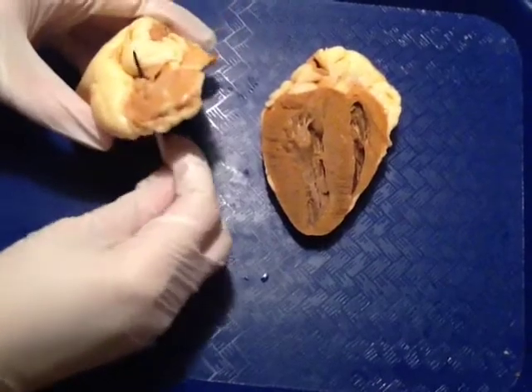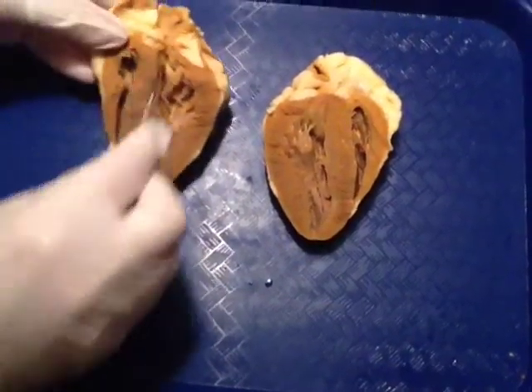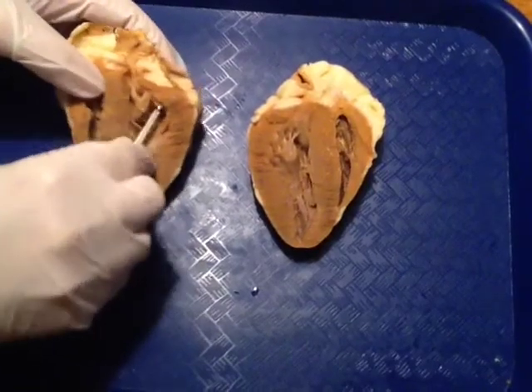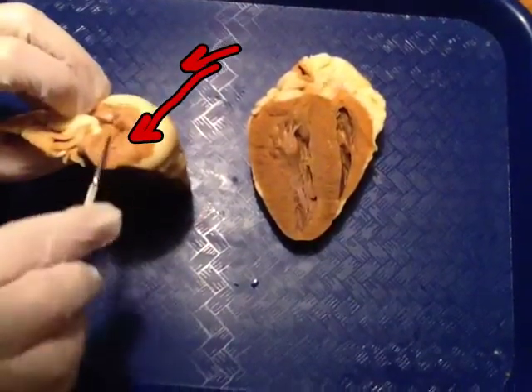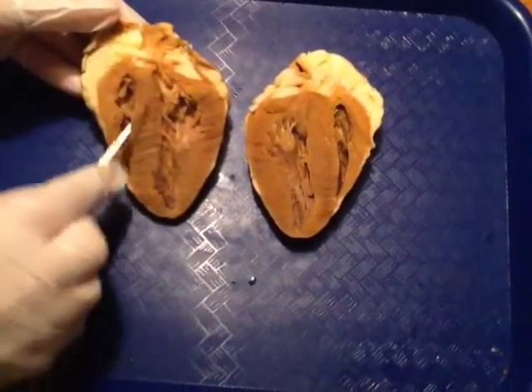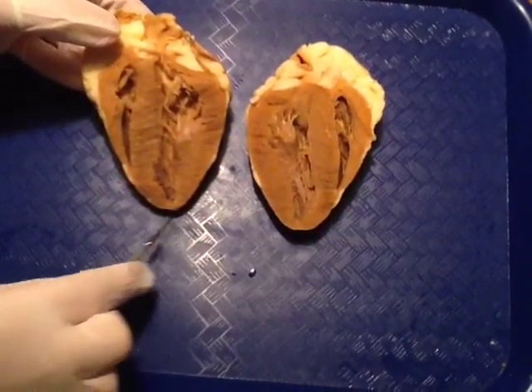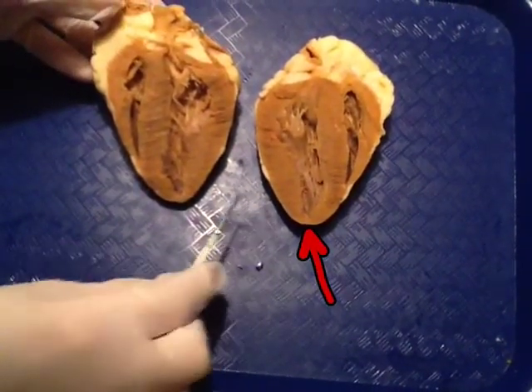We have the vena cava. We have the aorta. Also on the left side, these two pulmonary veins. This middle area of the heart is also called the septum. And at the bottom, the pointed area is called the apex.